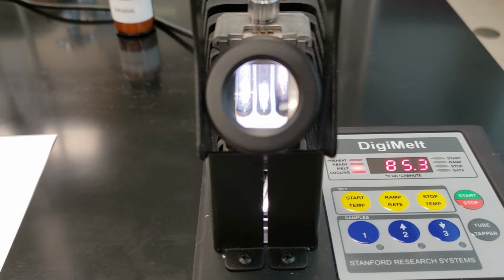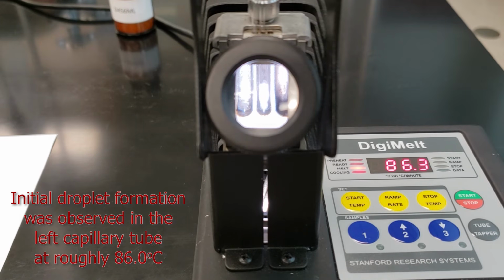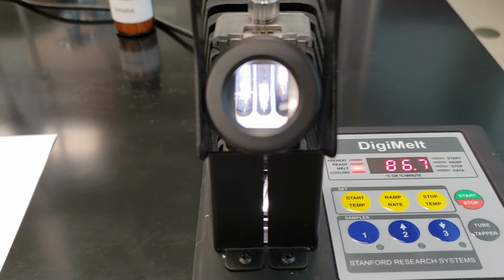On the left-hand side, our benzamide and unknown sample mixture, we're starting to see a little bit of weeping, a little bit of liquid formation here. The melting has begun at around 86 degrees. We'll have to keep an eye on that to see when the sample is fully melted.